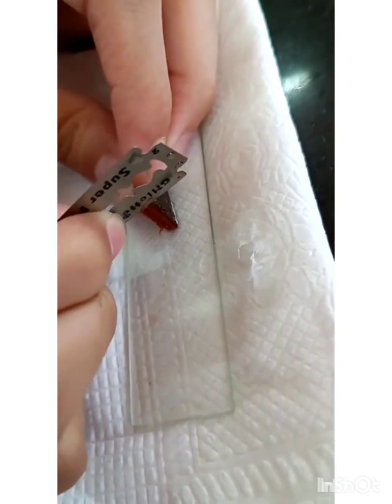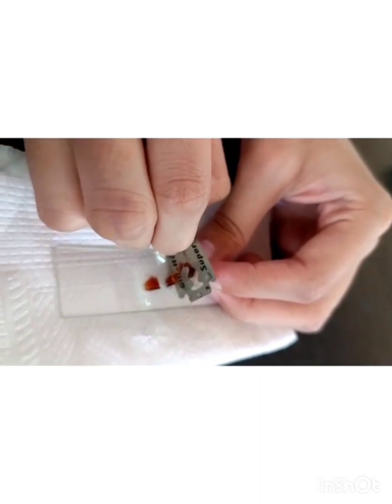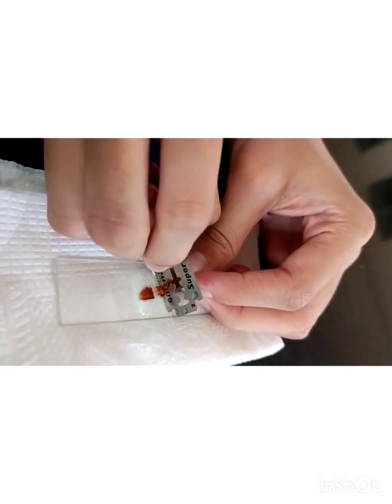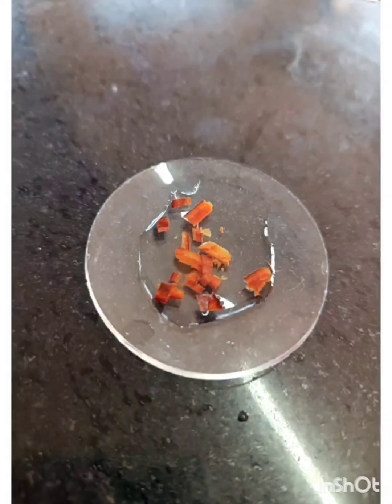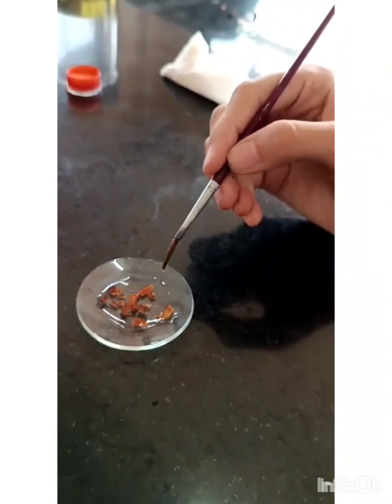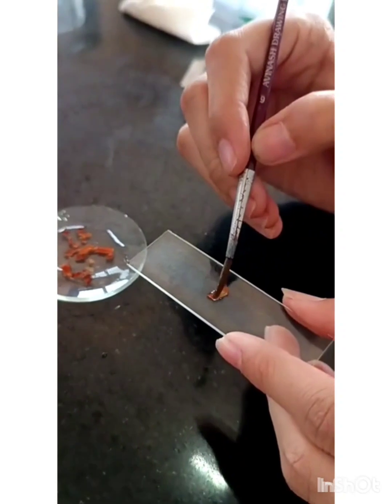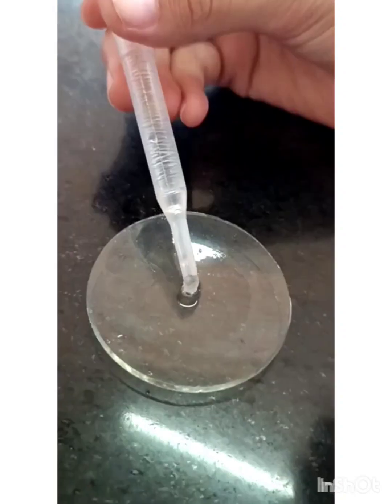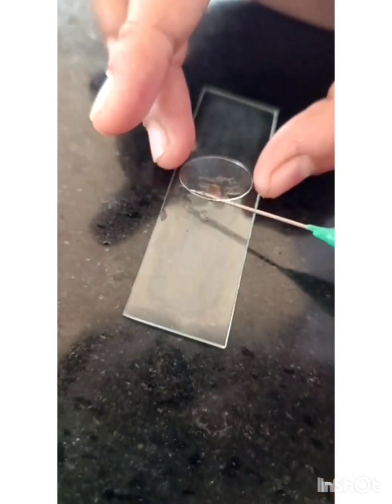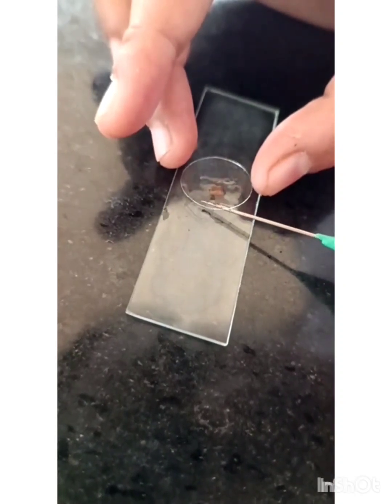The transverse section should be thin. Transfer the sections into the watch glass containing water. Take a thin section from your watch glass onto the slide. Add a drop of glycerin onto it. Put the cover slip over it. Avoid air bubbles while putting the cover slip on the slide.